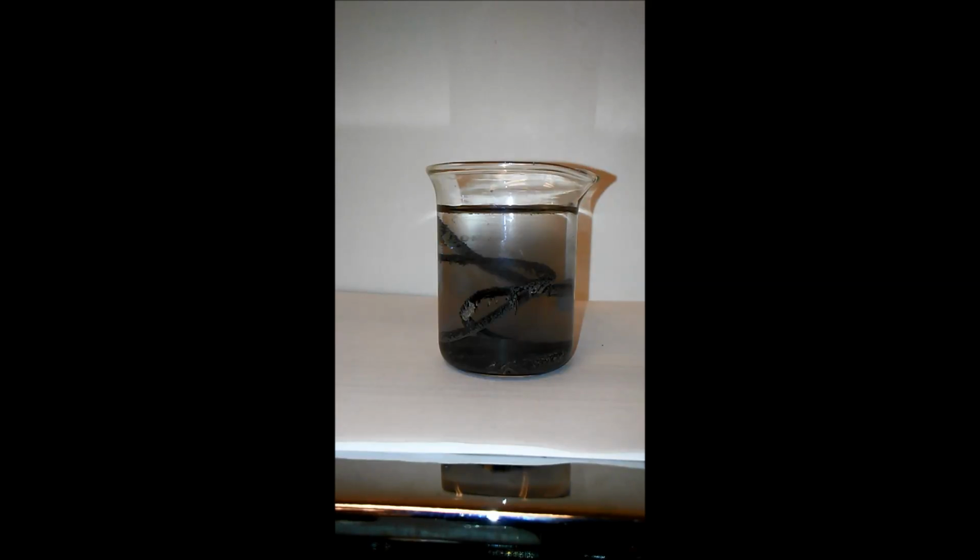It's part of what makes this solution as expensive as it is. It's about $50 for this bottle. And it's part of why when it's done, I won't dump it. The silver isn't actually worth all that much. But it's expensive to waste it and to buy this again, and so what I can actually do is do a reaction and dissolve everything that's in there and then extract the copper, in this case extract the iron, and then I'll have silver nitrate solution again that I can reuse in the future.